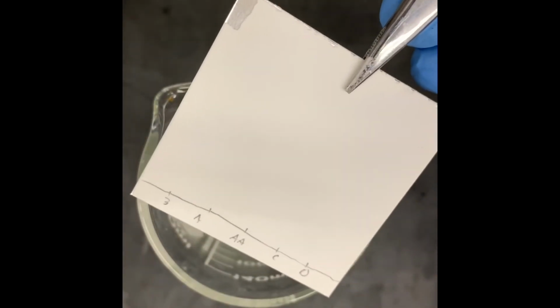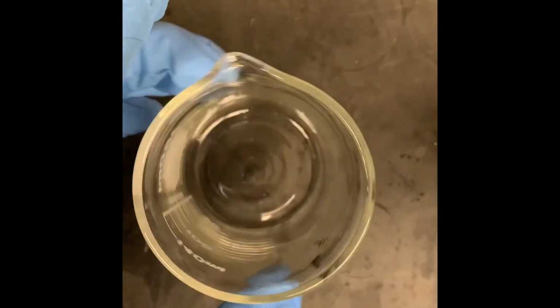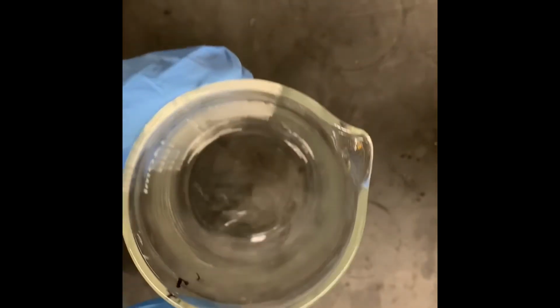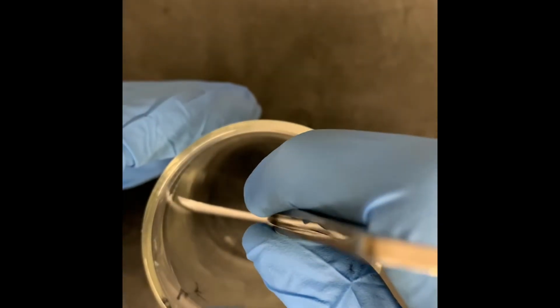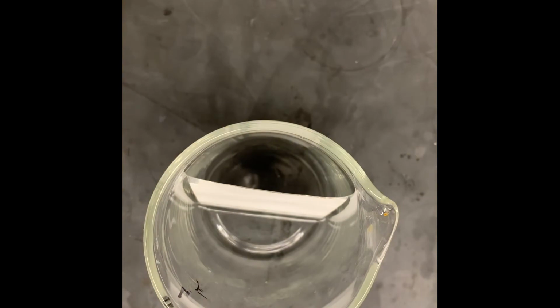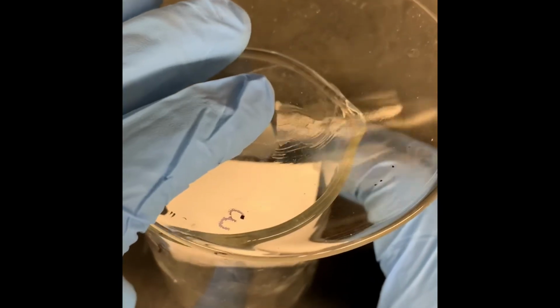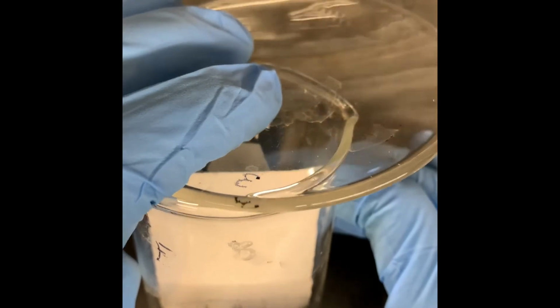So because we have a much larger TLC plate, we need a much larger solvent chamber to be able to place the TLC plate in. So I already filled our solvent chamber, our beaker, with our ideal solvent ratio, which you will have to determine. And I'm going to place my TLC plate into that solvent chamber, into the beaker, and place a watch glass on top. And then again, just like in part 1, we're going to see the solvent carry the compounds up the TLC plate. And once the solvent line gets close to the top of the TLC plate, we'll remove the watch glass and pull the TLC plate out of the beaker.